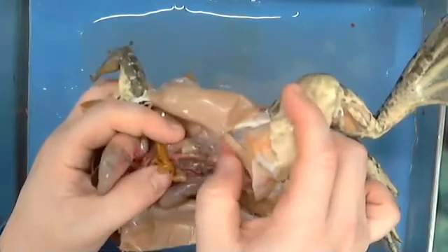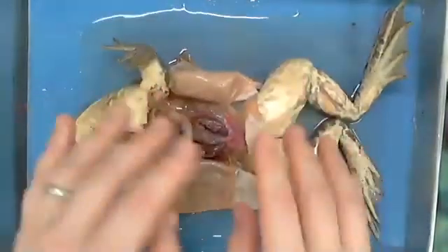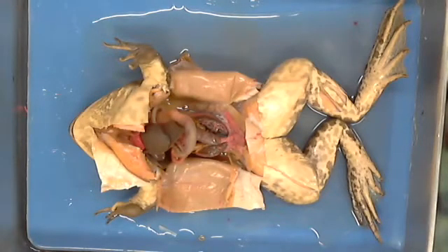Again, he's a male because you can tell he's missing all of this major organ that's on each side of his actual ovaries, and you'd see the difference. I'll try to find one to show you just to make things easy. But if you look in your pictures on your PDF, everything I pointed at, especially if you pull it up on your computer, is very clear. To me, it seems like you should almost have been able to look at that and take this test and not have a problem, because things are pretty drawn out really well. The things they're pointing at, et cetera, you should be able to kind of get a glance of. Okay. All right. Any other questions about internal structures? Do we all feel comfortable and good?